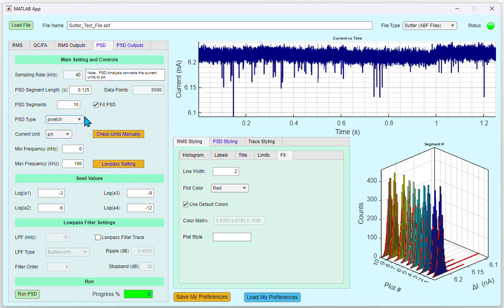Please ensure that the current unit is properly picked up by the program. Set the appropriate minimum and maximum frequencies for the PSD analysis using these options. For the fitting, the seed values for each of the noise coefficients can be entered using these options. By default, they're in log scale. If you want to low-pass filter the trace, you could click the low-pass filter trace option. The operation of these fields is similar to what we saw in the RMS tab.